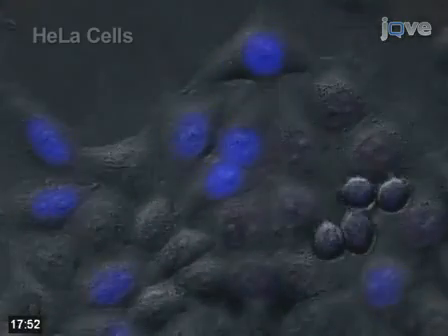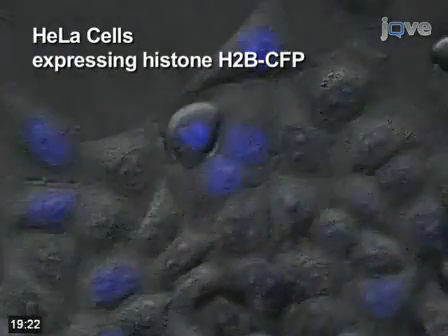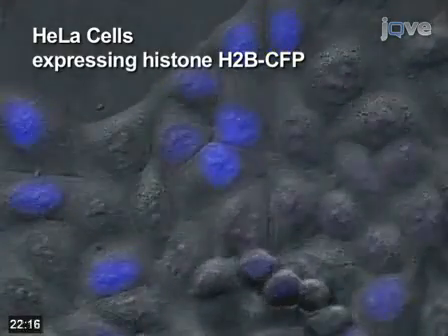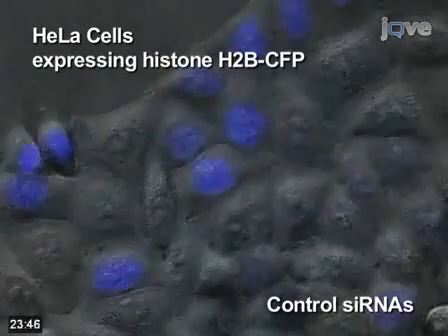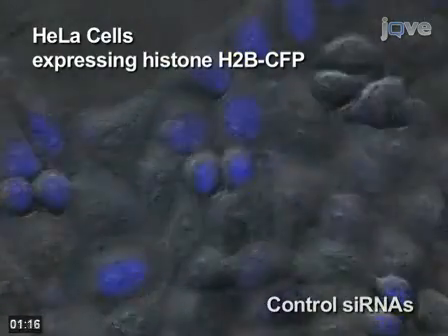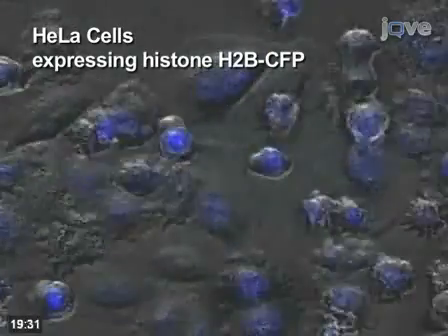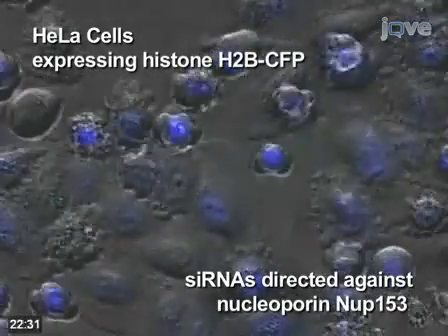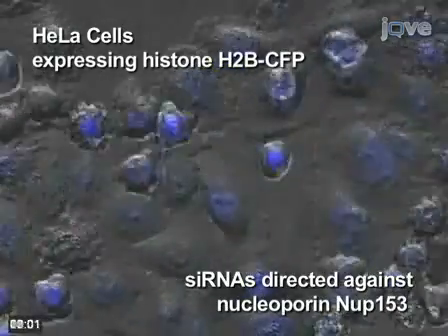Time-lapse imaging of HeLa cells expressing histone H2B-CFP is shown. These cells were transfected with control siRNAs and progress normally through the cell cycle. In comparison, cells that were transfected with siRNAs directed against nucleoporin NUP153 display severe alterations in mitotic progression.